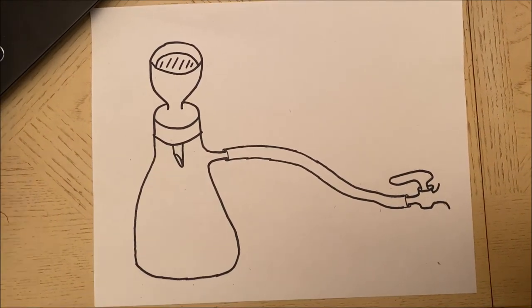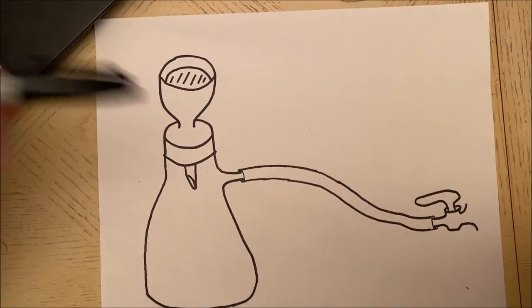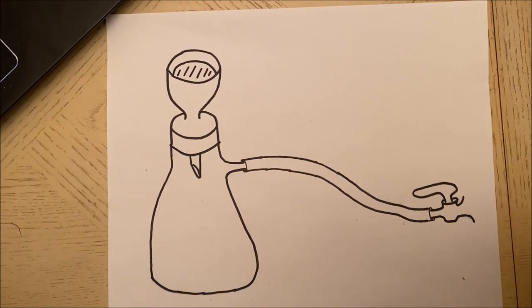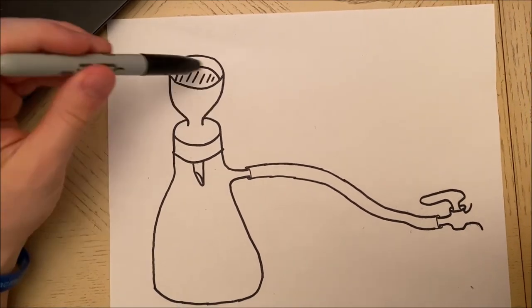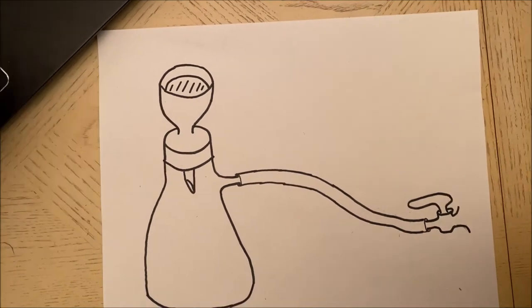The first thing we're going to have to do is actually wet the paper with the solvent that we're going to use, just a little bit so that it actually adheres to the plate and nothing can get underneath the filter paper. If this happens we're going to have to restart completely.